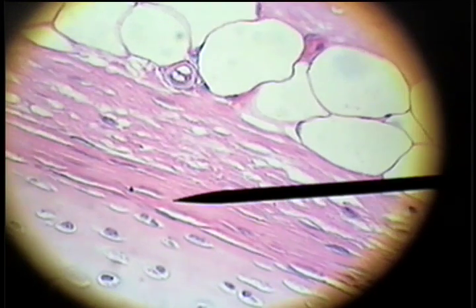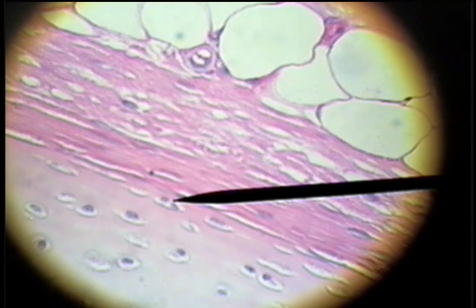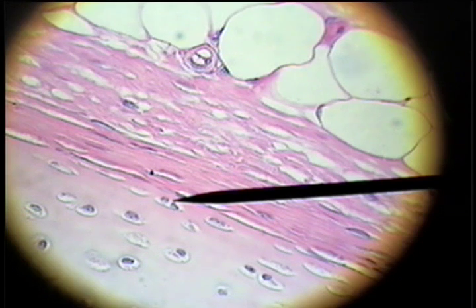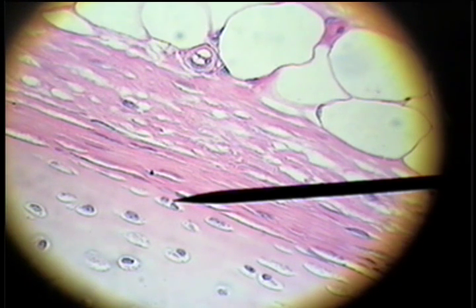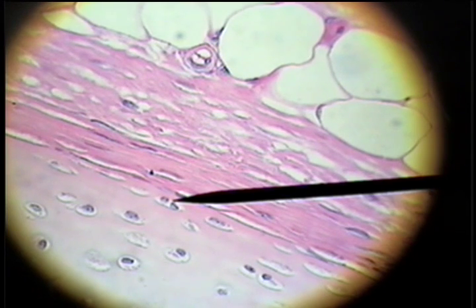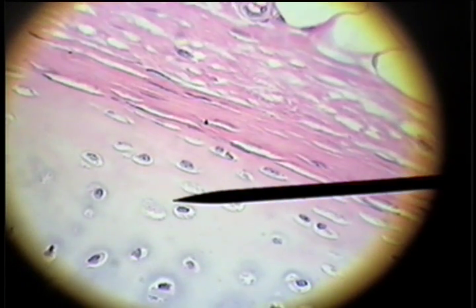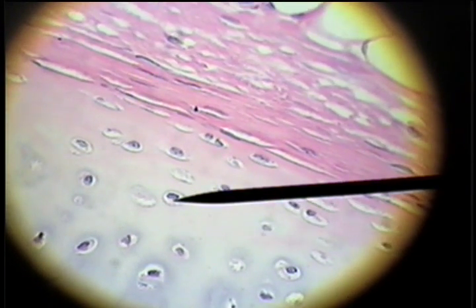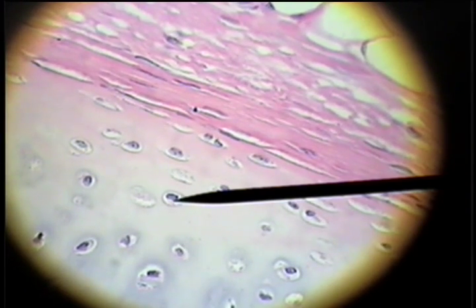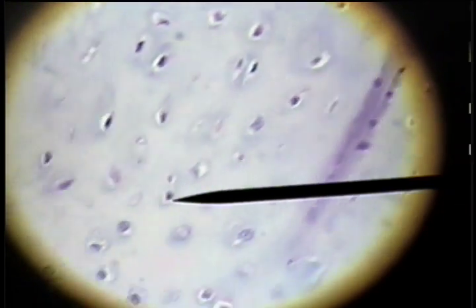As they mature, there are usually two of them in a little compartment in the ground substance, and this is called a lacuna. The white space is a lacuna, and in that space are the two nuclei of this paired chondrocyte. As we go into the center of the cartilage, we see the lacuna with a chondrocyte, or adult cartilage cell. This is characteristic of hyaline cartilage.